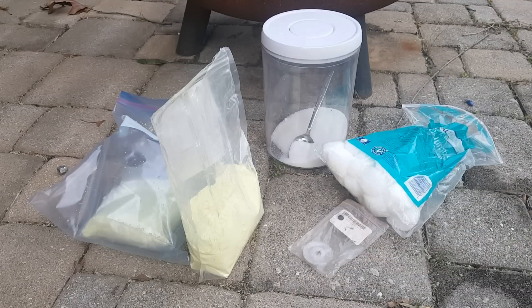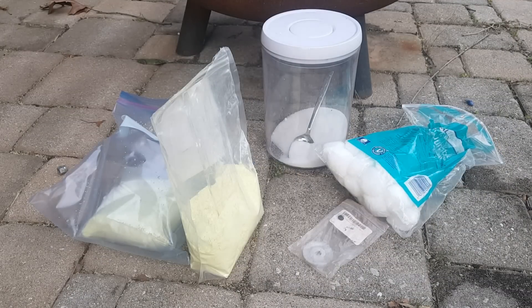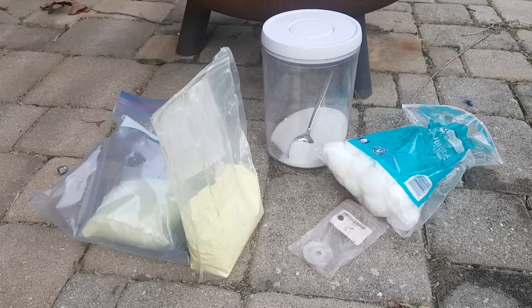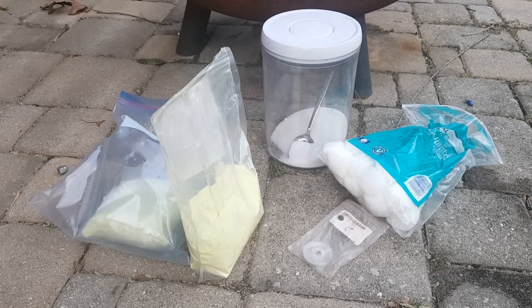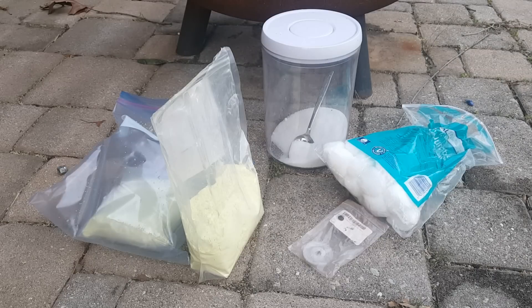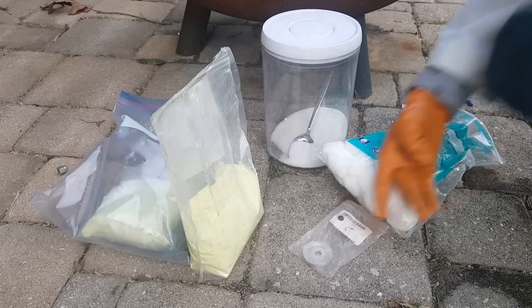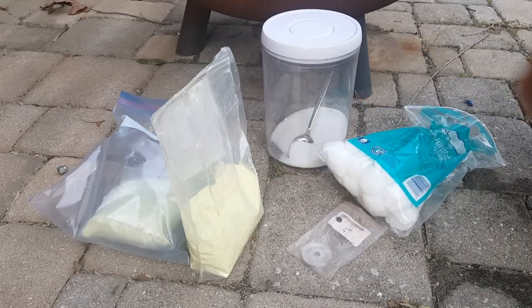Now that I'm outside, I'm going to test several different materials on the acid. I've found that this acid will attack just about any material you put into it. I'm curious to see which reaction will be most violent, which reaction might give off flames, and stuff like that. I've got magnesium, cotton balls, sulfur, and sugar here.